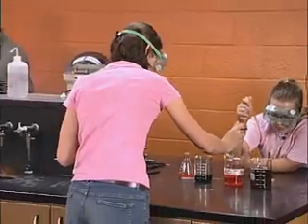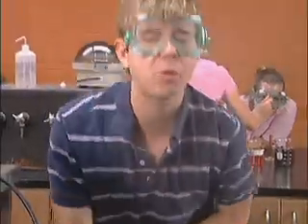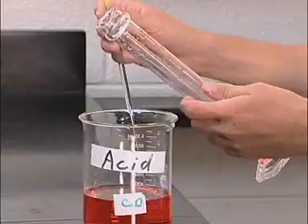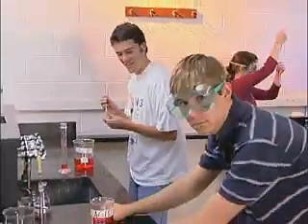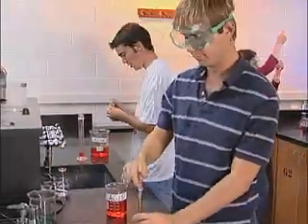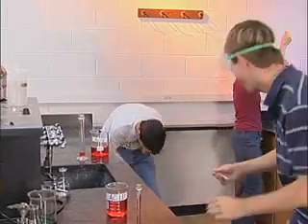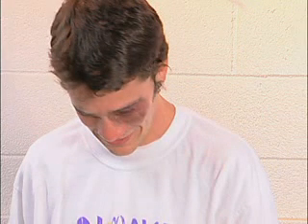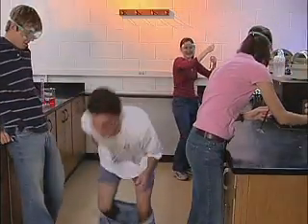Rule number 8, pipetting by mouth suction is strictly forbidden. Rule number 3, eye safety equipment must be worn at all times. Rule number 10, all lab workers must know the location and proper use of all laboratory safety equipment. Rule number 4, loose hair and clothing must be restrained.